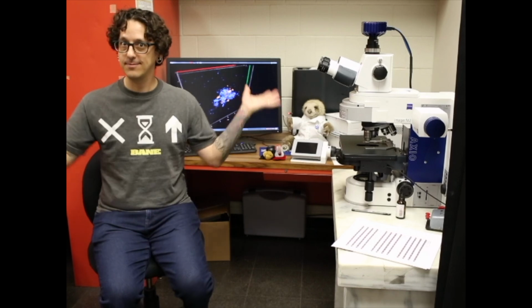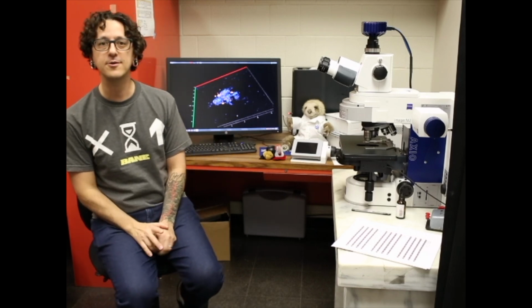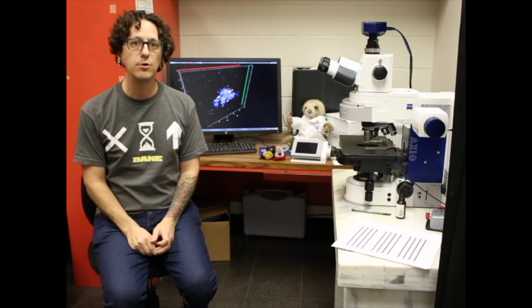It's me, Jason Sylvan again, still at Texas A&M University if you're watching this video, probably right after the one you just saw. And we've moved from the room that I was in before, where we run DNA gels to see if we're doing lab work correctly, basically. We moved from there into my microscope room.